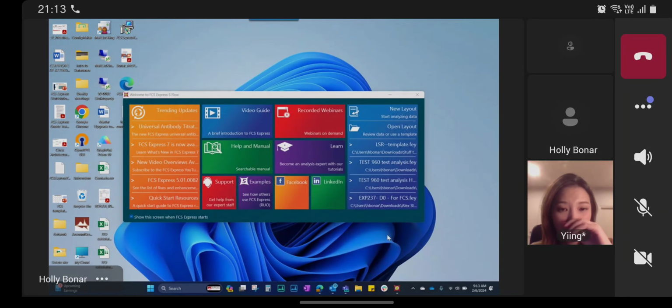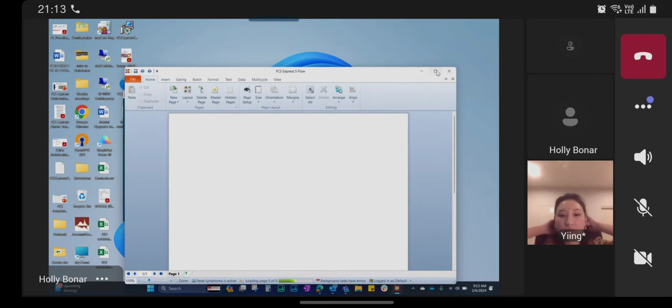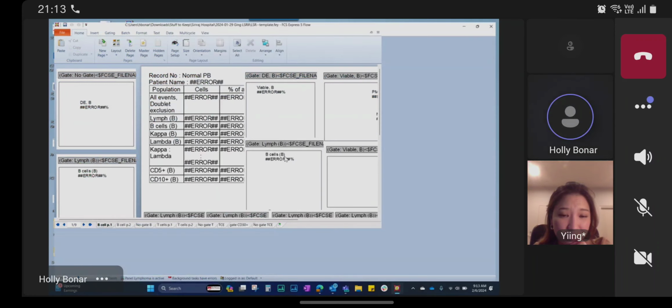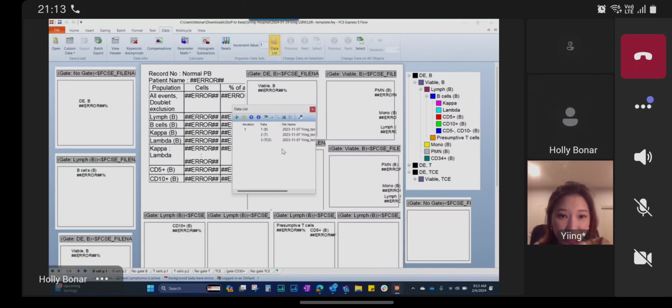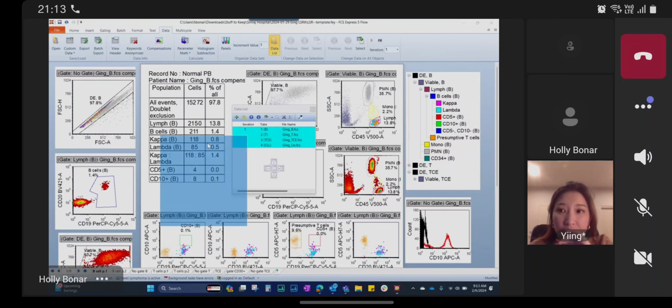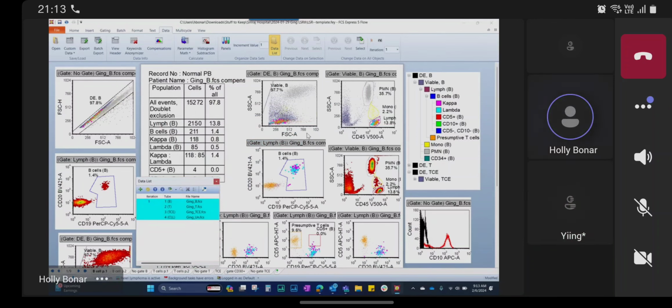Yeah. My computer is slow. Right, okay, so here's your blank template. Yeah. Load your files. So I'm loading the files that were in that LSR2 folder. So this looks correct, right? Yeah. But it looked like what you were showing me on your screen, that it was a different layout than what you gave me. This layout that you gave me works perfect.